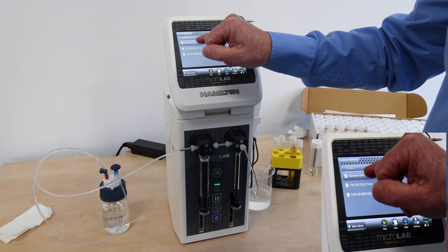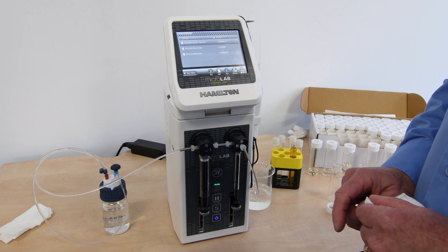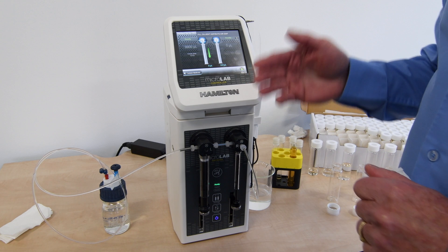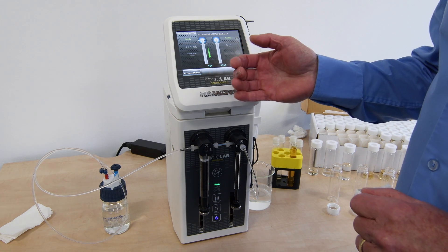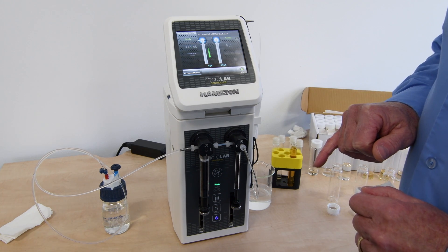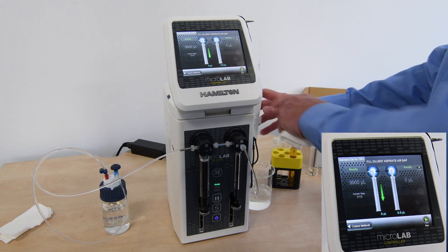We've selected that program and I can now go into the run mode for this particular program, which will begin the standard set. We're starting with a 1 in 100 dilution. The first step is to take 9,900 microlitres — you can see the first step shows fill diluent and aspirate air gap.